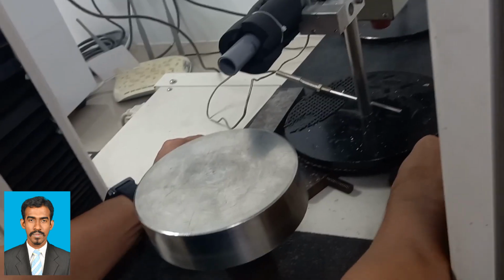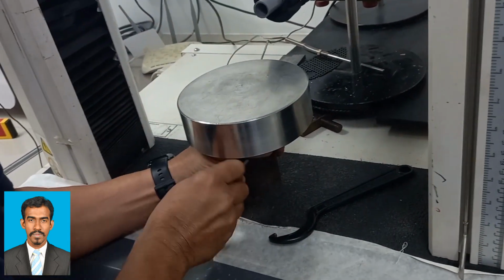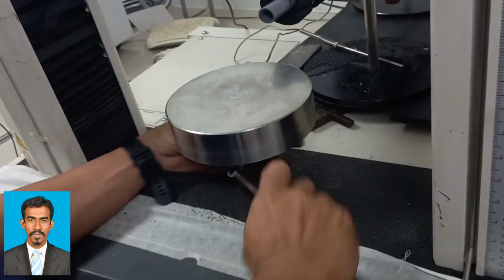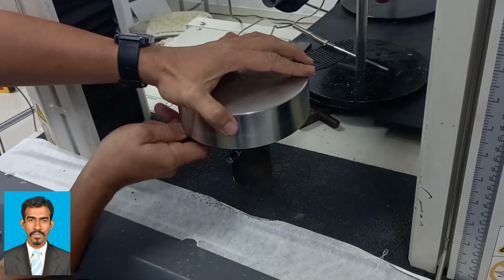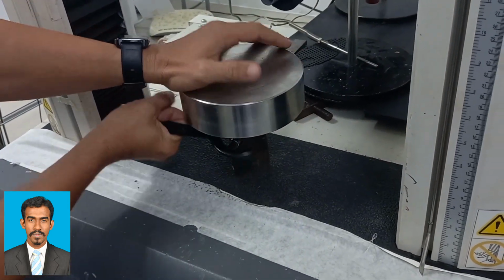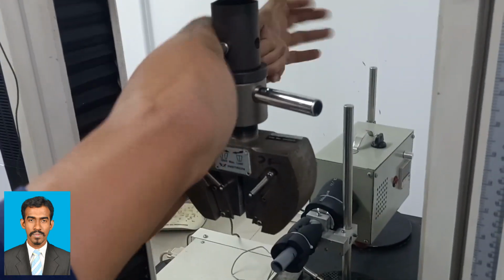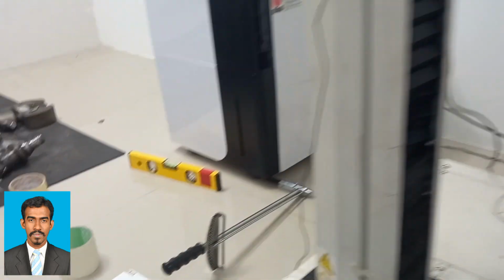During a compression test, properties of the material including sample stress and strain are measured and various calculations made. Data is plotted as a stress-strain diagram. Data is used to determine qualities such as compressive strength, elastic limit, proportional limit, yield point, yield strength, and modulus of elasticity.